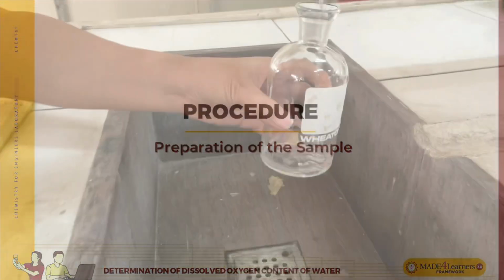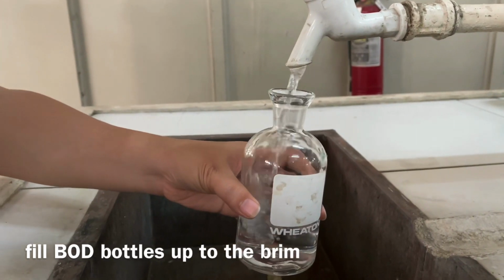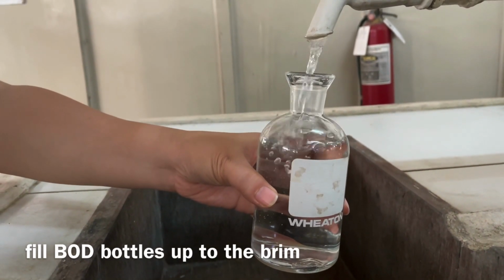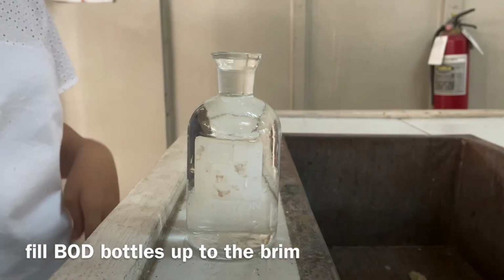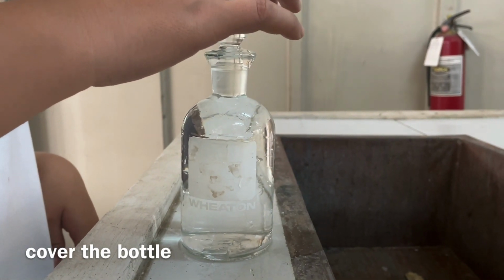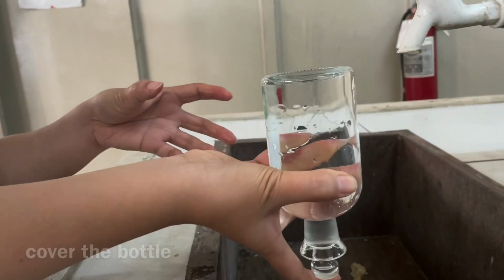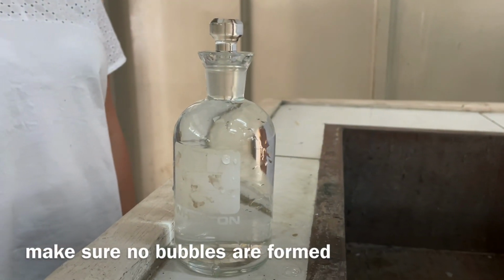The preparation of the sample. Fill the 300 ml BOD bottles with a water sample up to the brim. When full, cover the bottle and remove excess water. Make sure that no bubbles are formed.